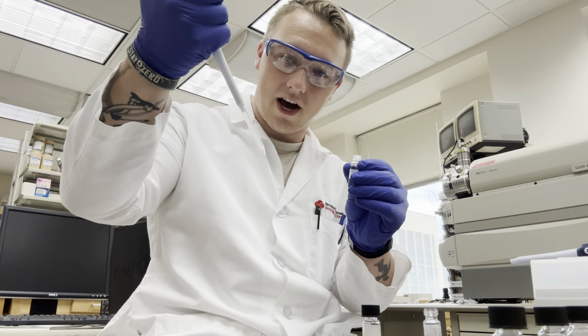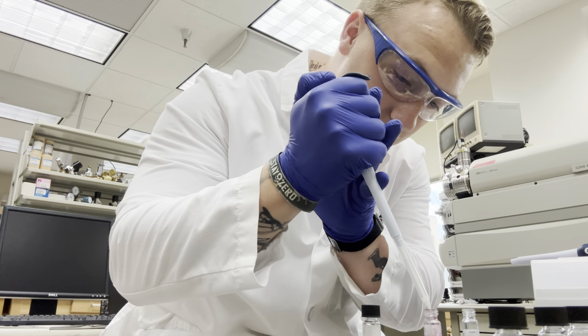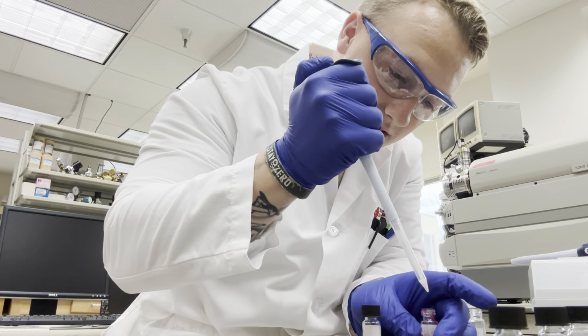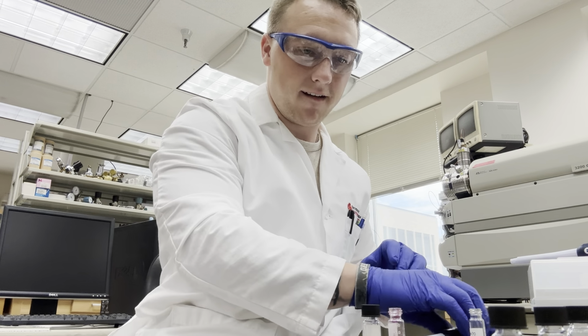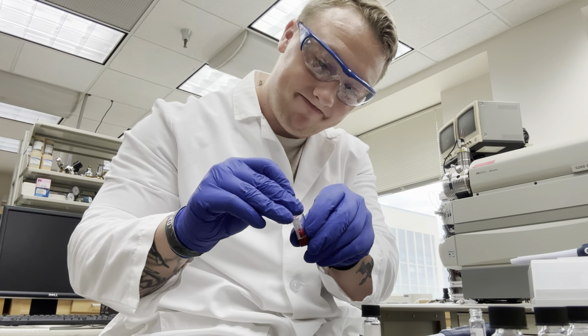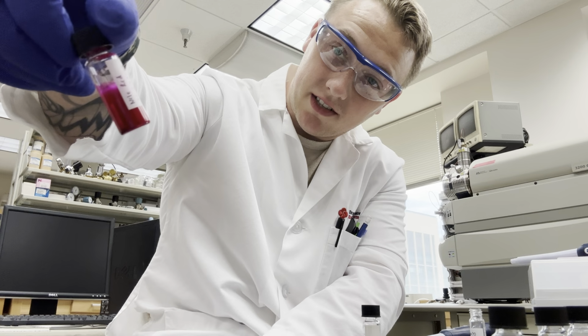Got our concentration here. We made sure there's no air bubbles. And boom. Again, just make sure nice and stable. Expelling all that DMSO. And then we're going to kind of wick the sides, make sure we get all of it out. Want to make sure we're staying as accurate as possible. And then we cap it. And look at that bright red color.